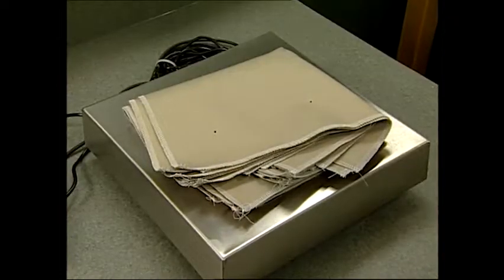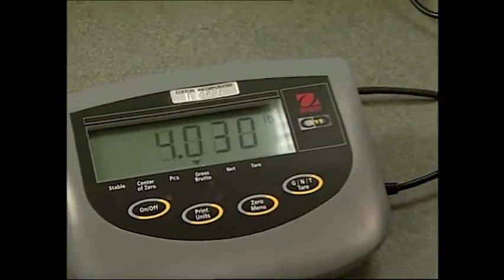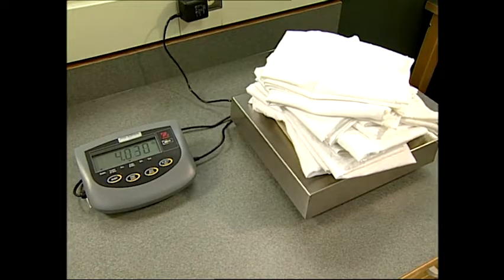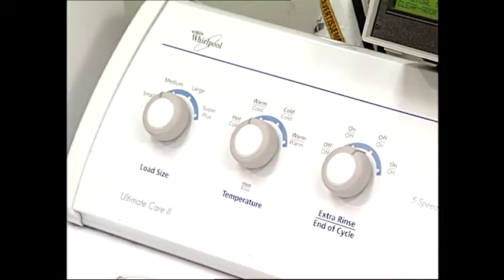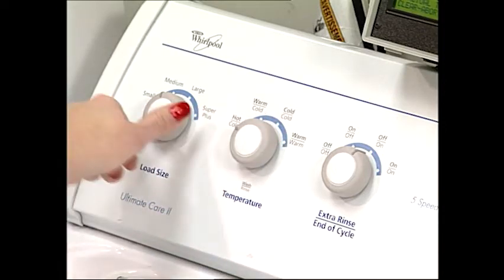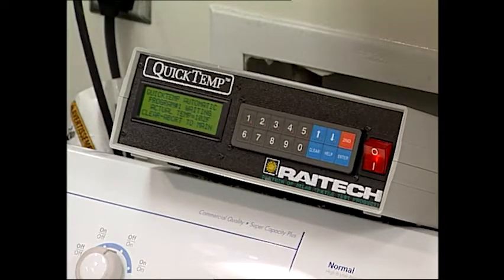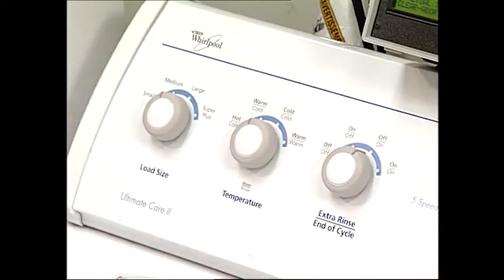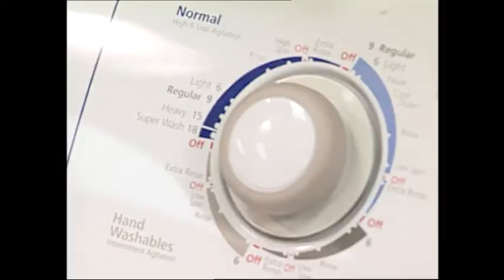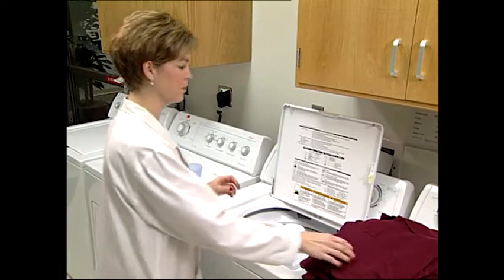The load size should consist of test specimens and enough ballast pieces to make a 4.0 pound dry weight load. Woven and knitted specimens should be washed separately from each other, with exceptions for garments containing panels of both woven and knitted fabrics. Set the water temperature control to the appropriate setting for the wash and rinse temperatures, and check the wash temperature with a dip thermometer. Fill the washer to the water level setting required to achieve an 18-gallon level. Set the washer for a 12-minute normal cycle and add the required amount of standard detergent.